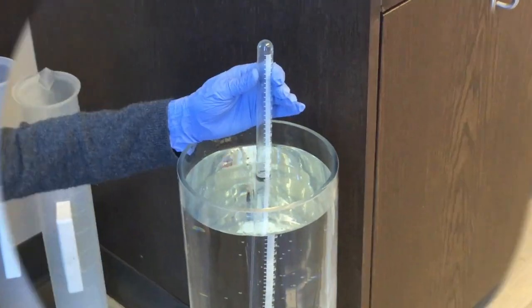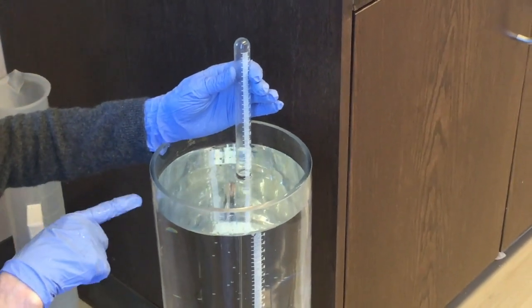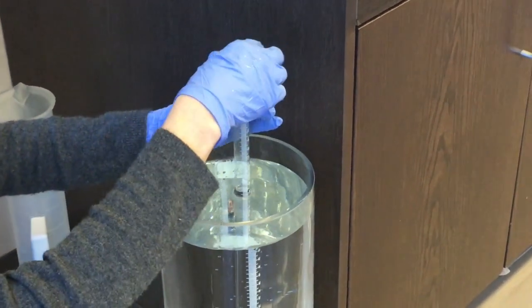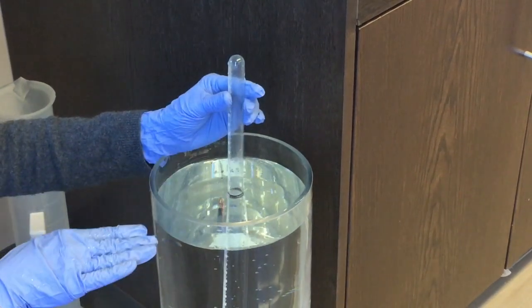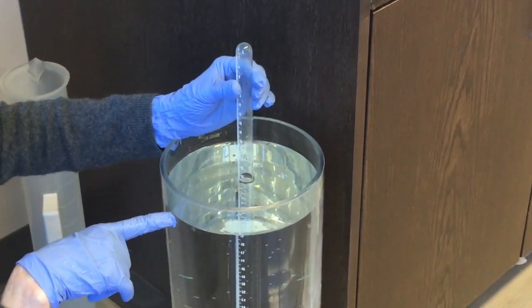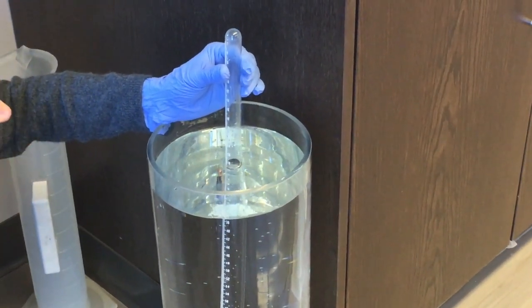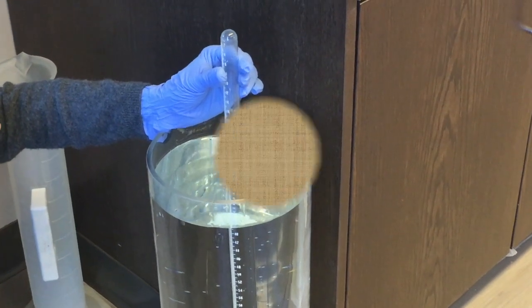So it's tricky because it's hard to read the volume like this. So what you have to do is to make sure that the water inside is at the same level as the water outside in the tank. When you get both of those lined up, you then have to read the water level.